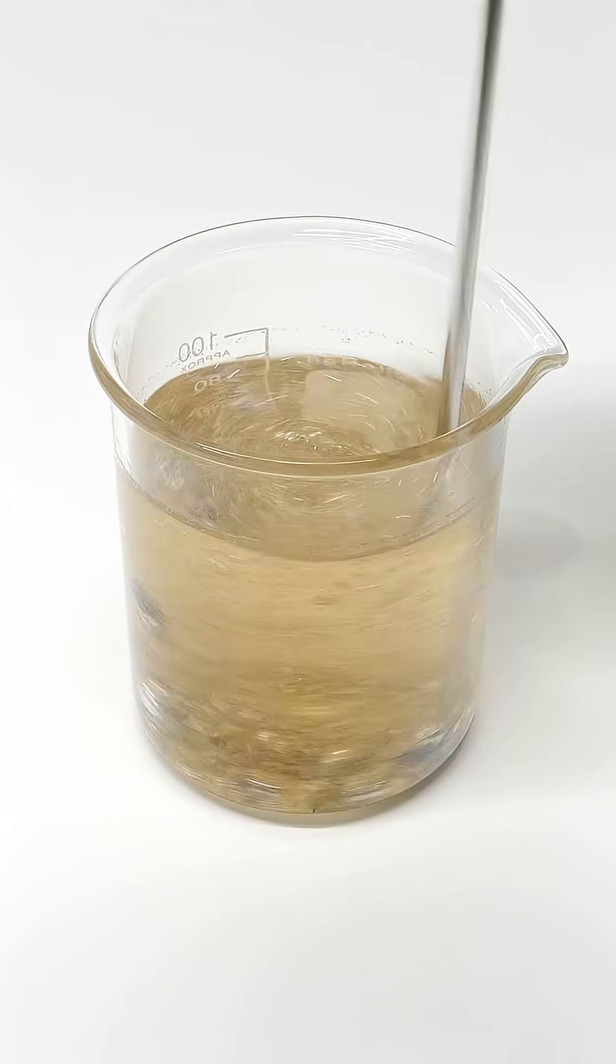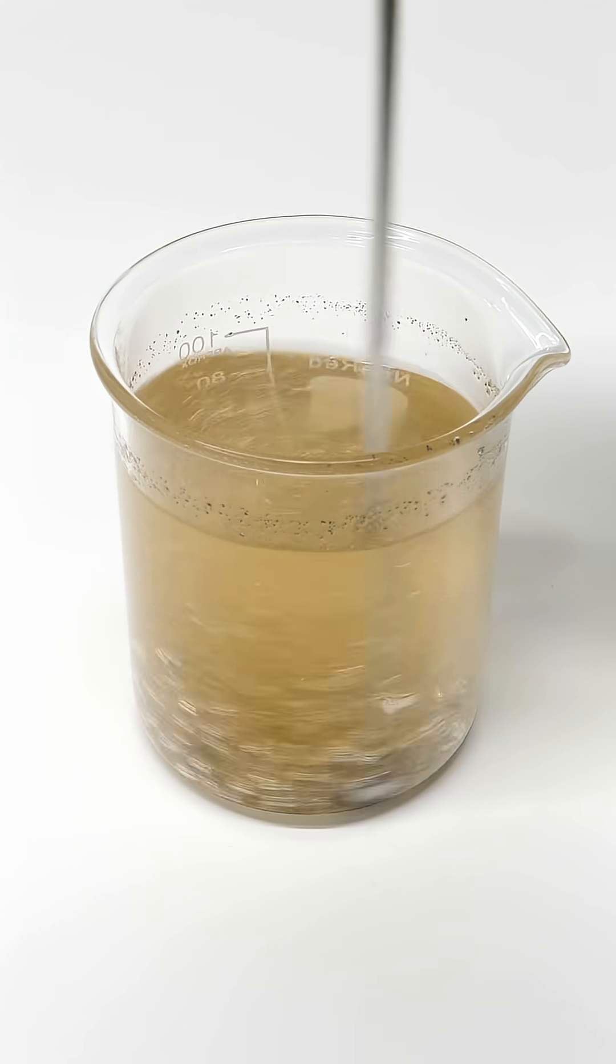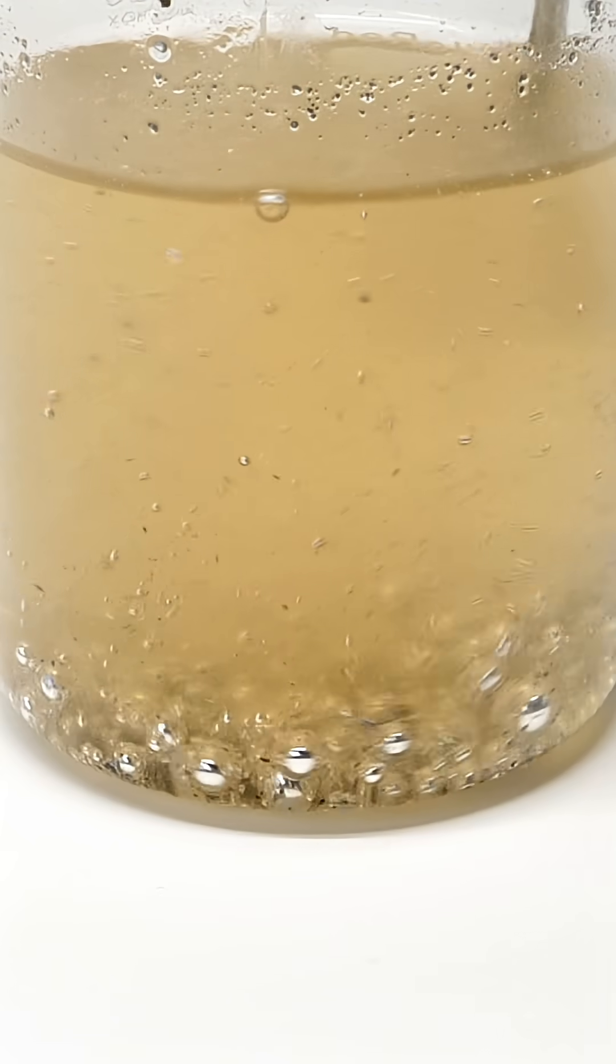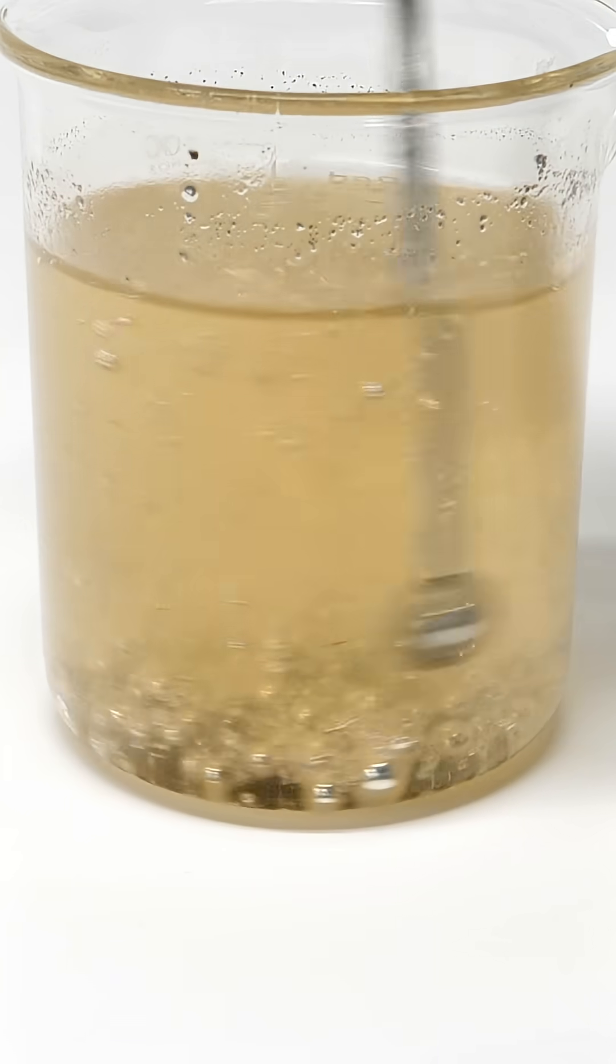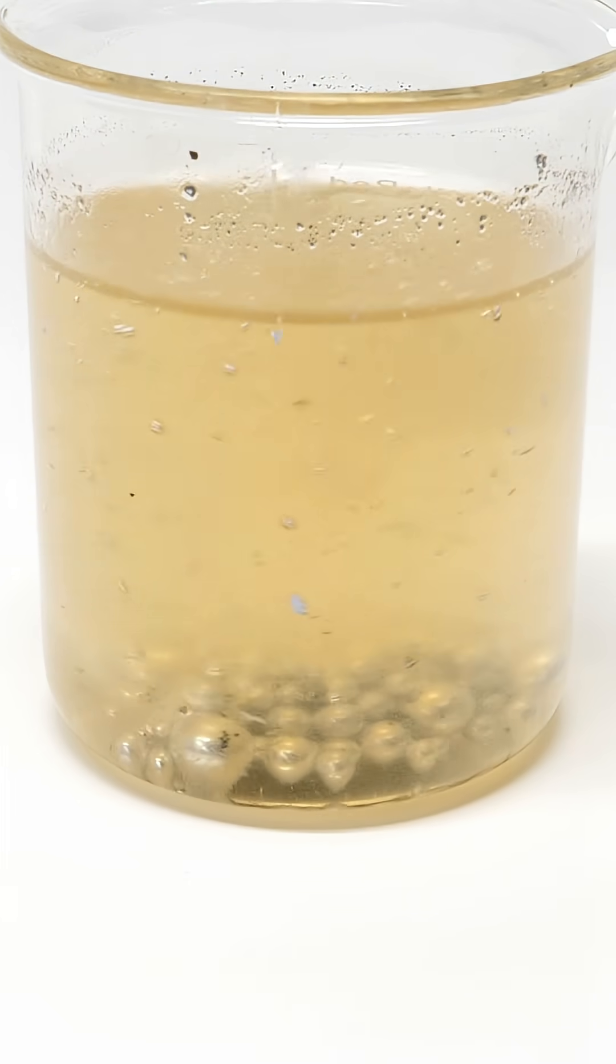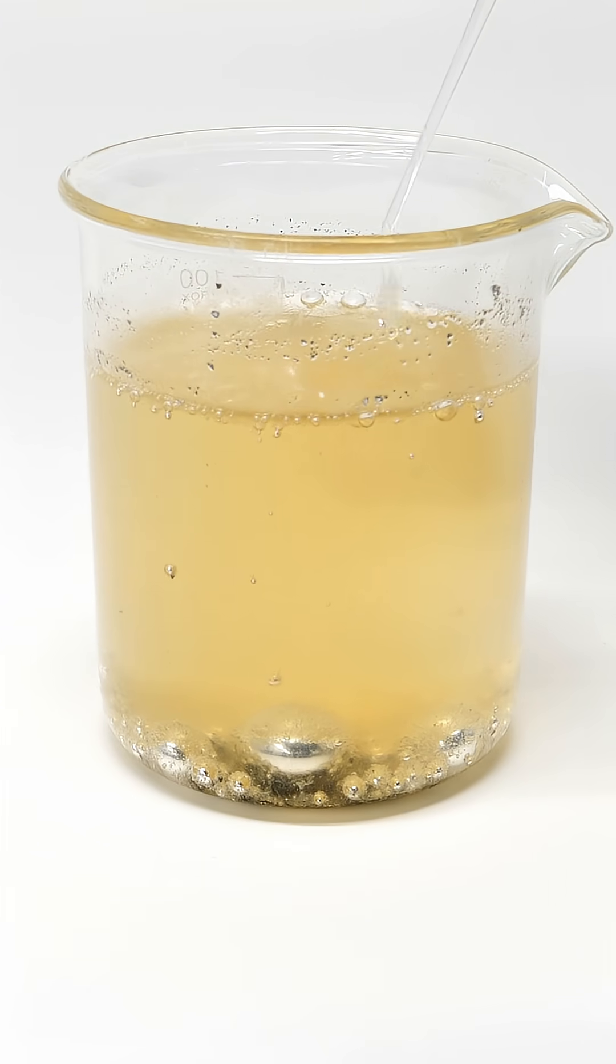I then stirred it around and occasionally added more ethanol, and eventually I had a bunch of small and extremely reactive metal balls. They were kind of refusing to combine though, until I added a bunch of ethanol all at once.